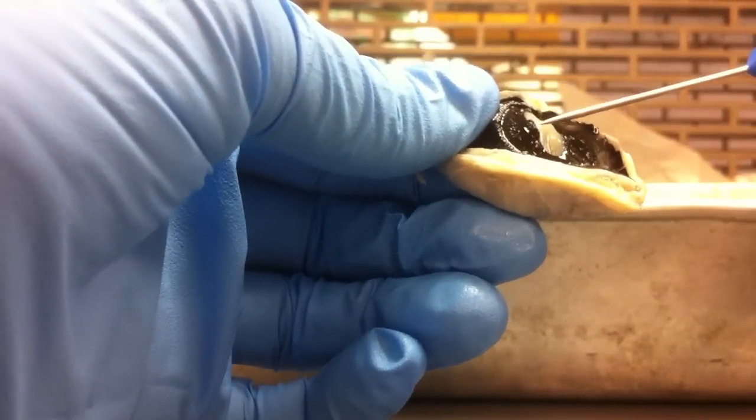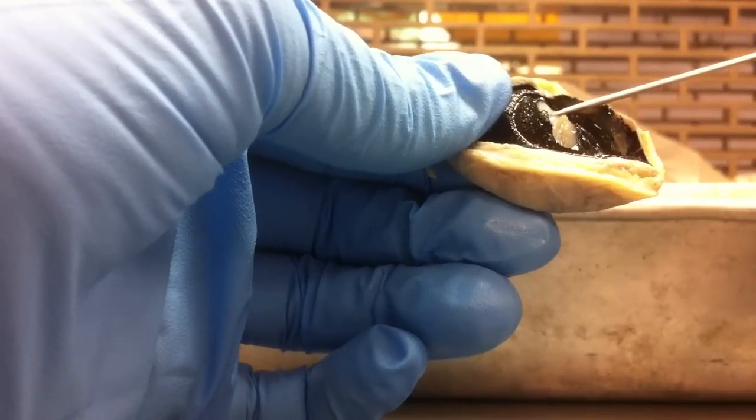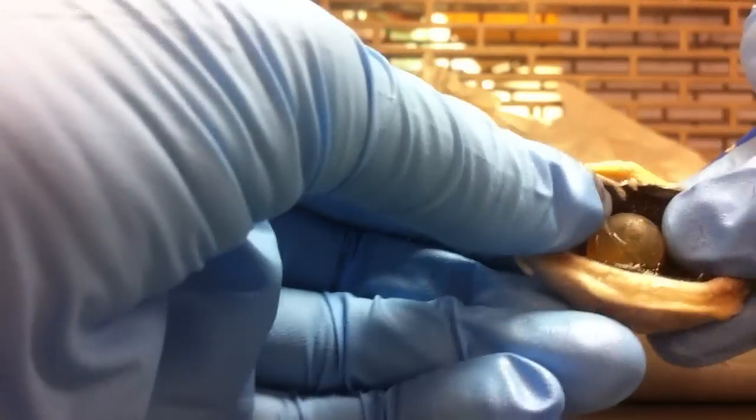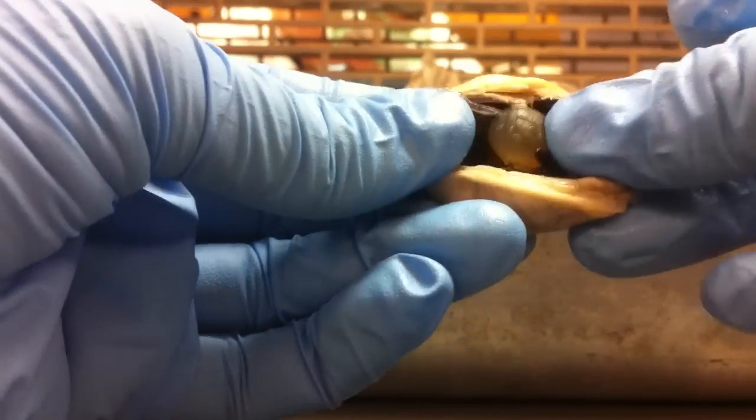Right here, these little flaps—that's your iris. Your lens is right there, which sits inside.